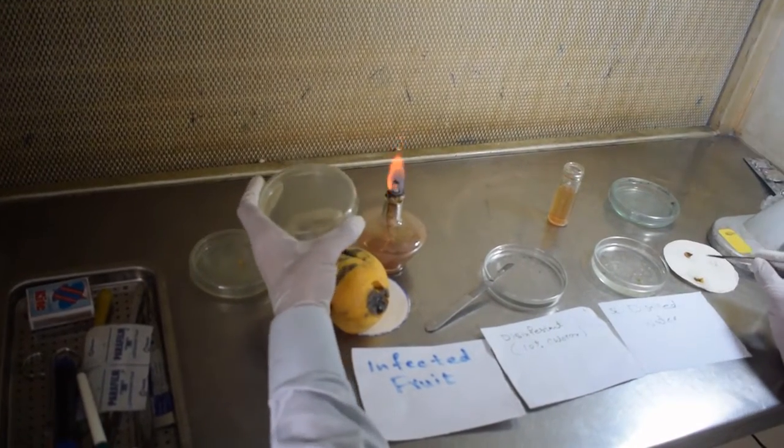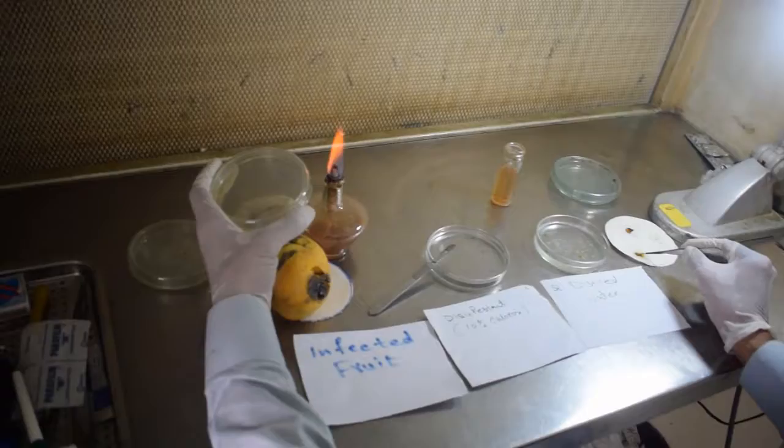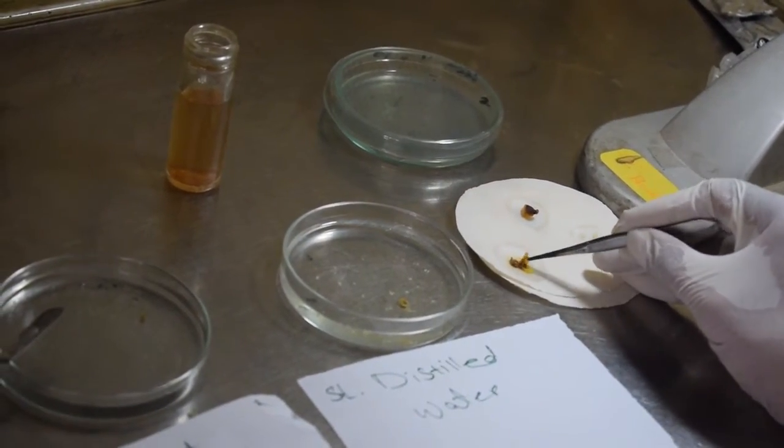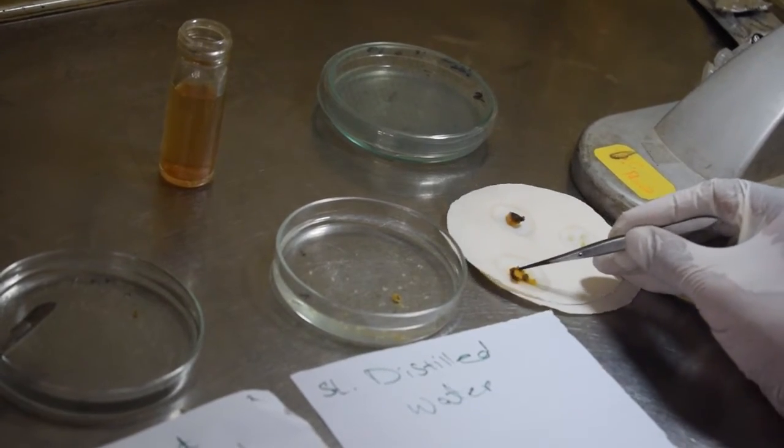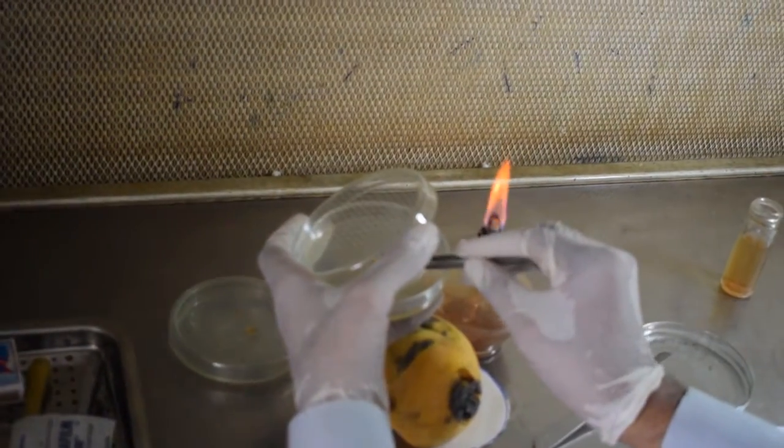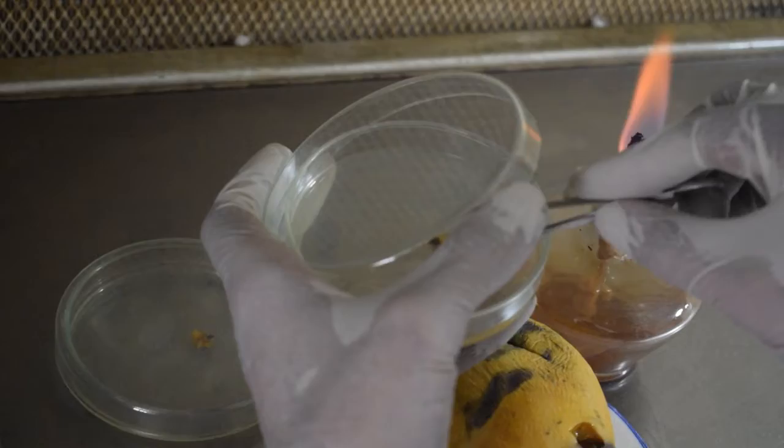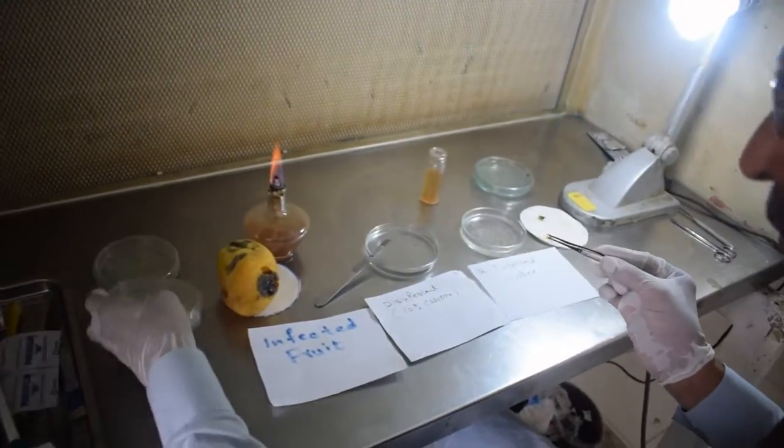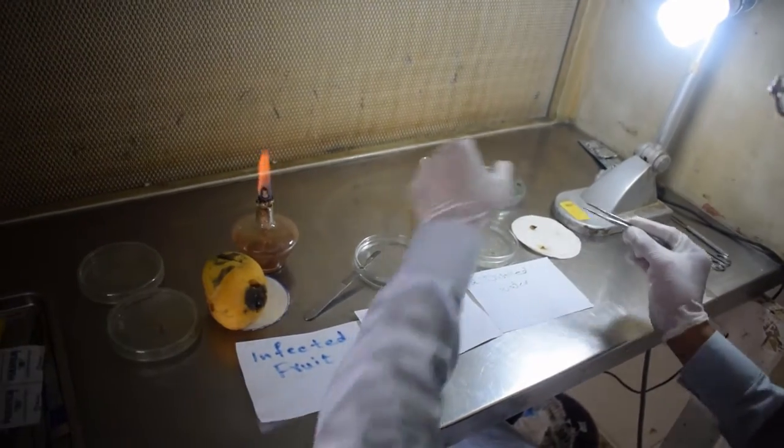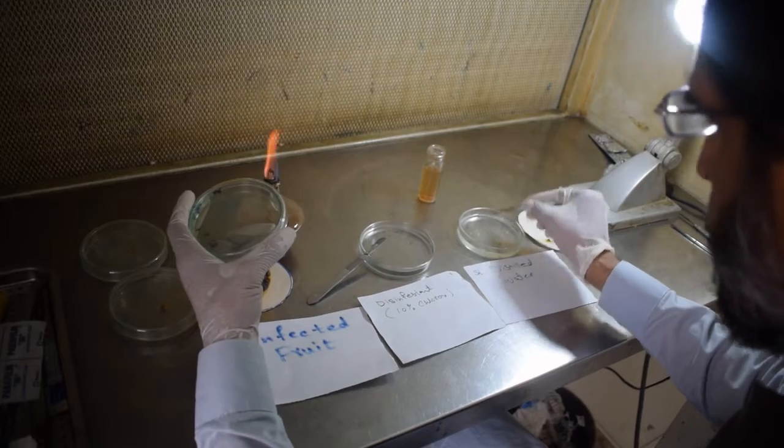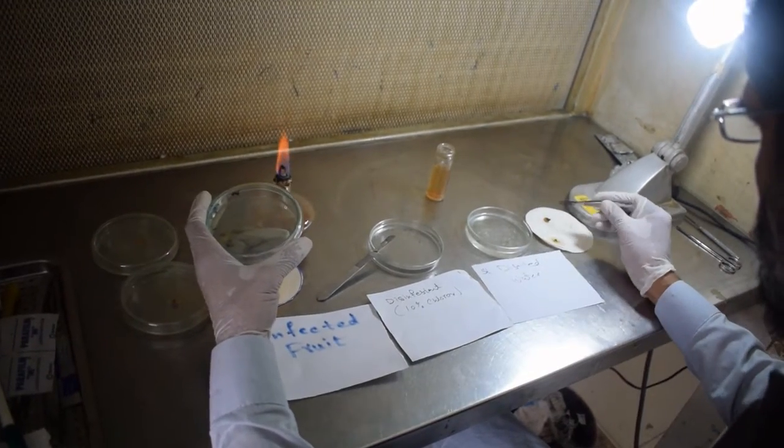Wait for a while, and we should take this one. I am taking as you are seeing here. Another one, like a plate, and this is the third one.